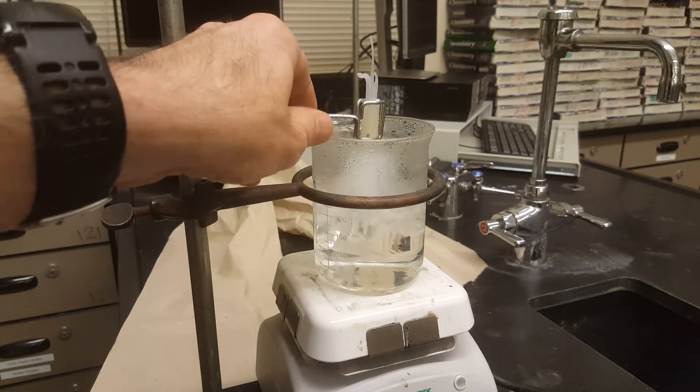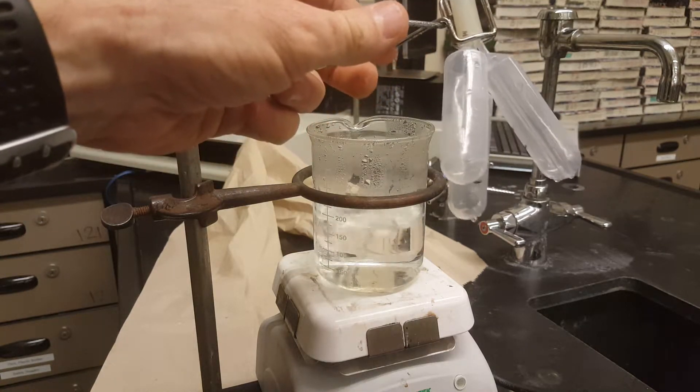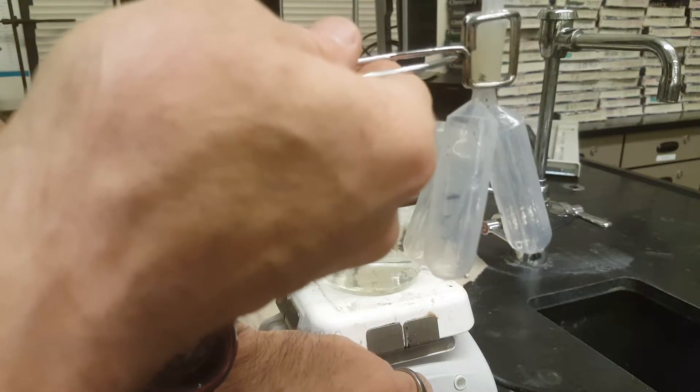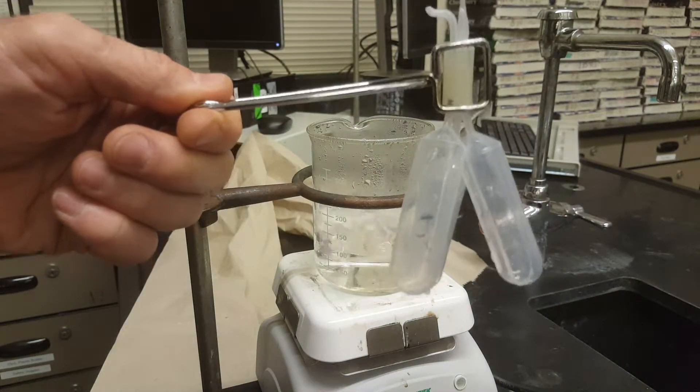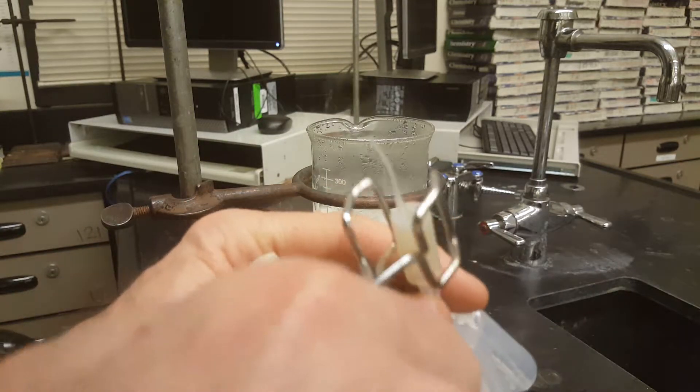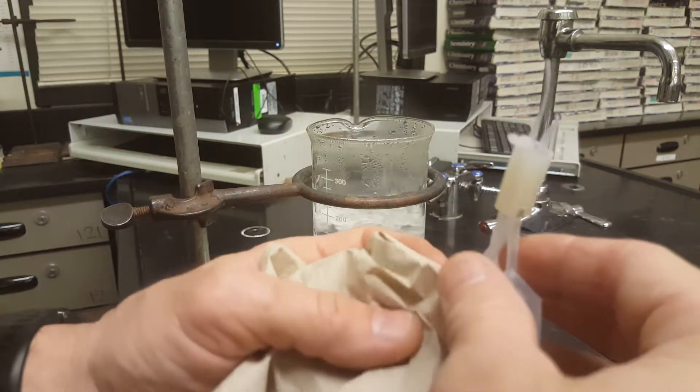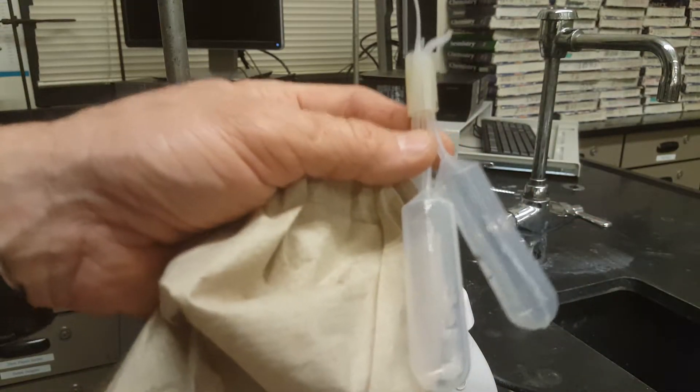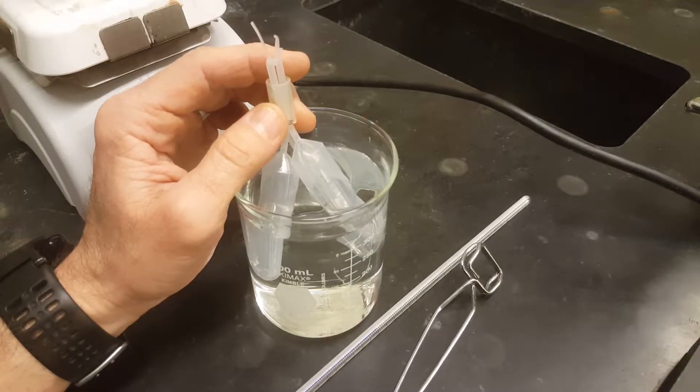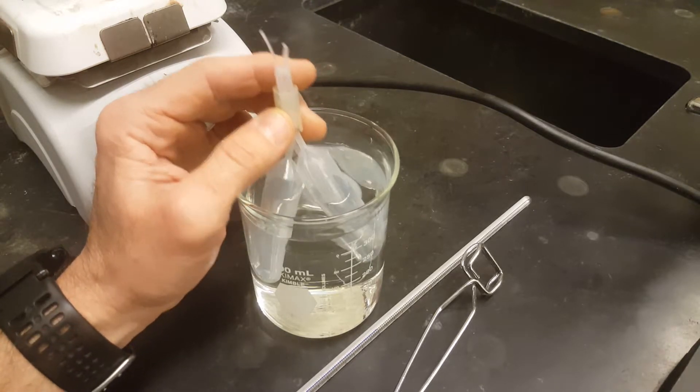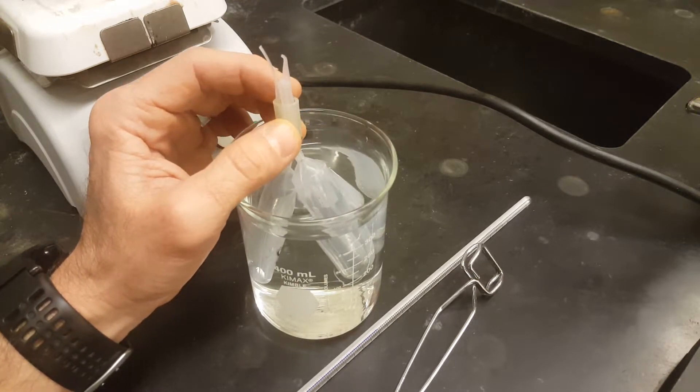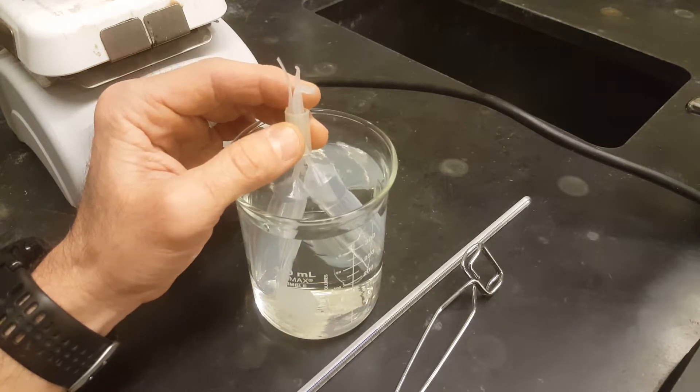My liquids have all boiled off and when I pull this out, I shouldn't see any liquids in here because it's all gas. And I did this the instant that the last little piece of liquid, the last little drop of liquid evaporated. And I'm going to take my paper towel and dry off my pipettes and put these guys back on the scale once they're allowed to cool. But to cool, you need to put them in some room temperature water. You guys are all going to have a second beaker that has room temperature water in it and that's going to help to condense the gas that was left in your pipettes so you can find the mass of the liquids now.